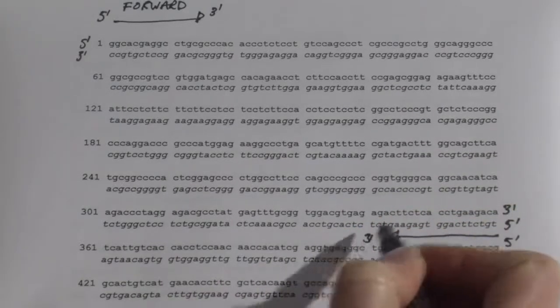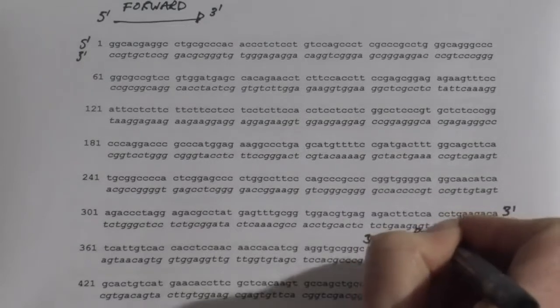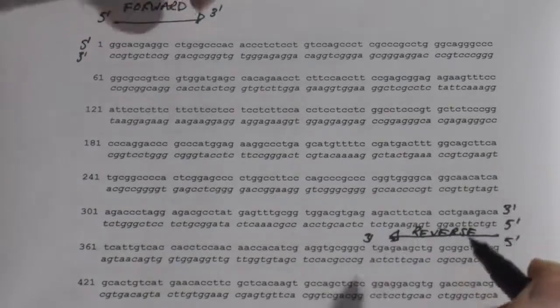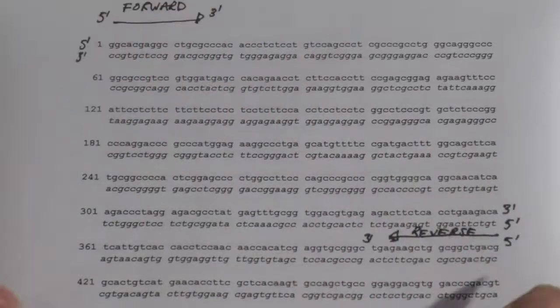Putting the 5' and the 3' is forcing the direction of these primers in the direction that's been shown. And obviously this is the direction these primers must run in. If my primers were facing outwards, I would never be synthesizing the product that's in between the two.